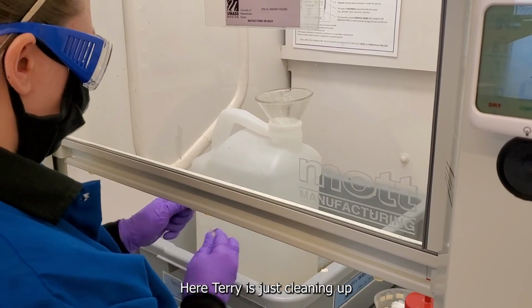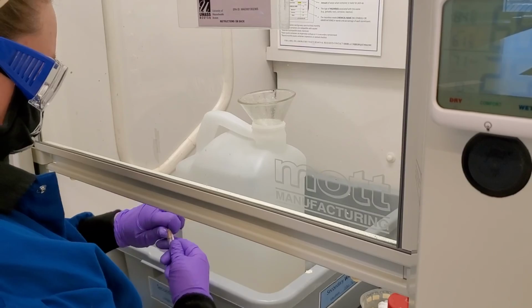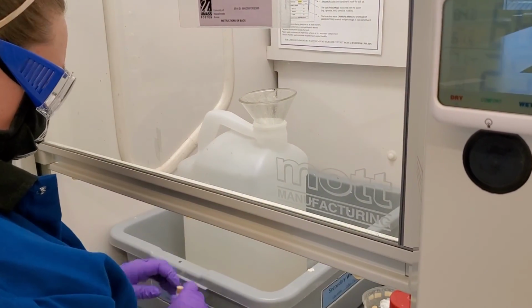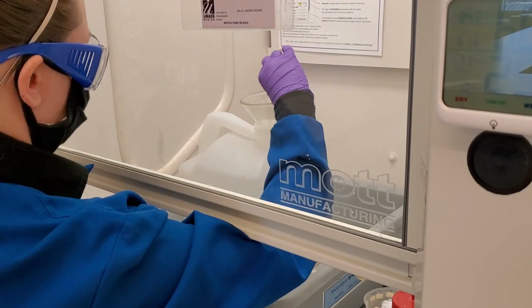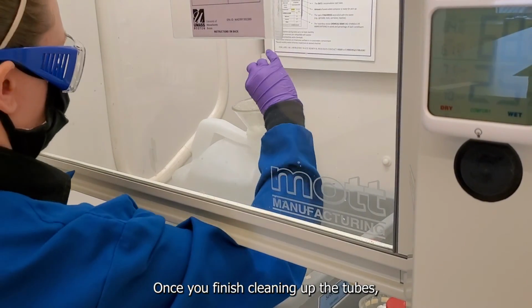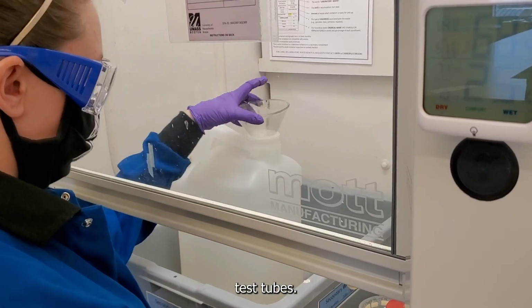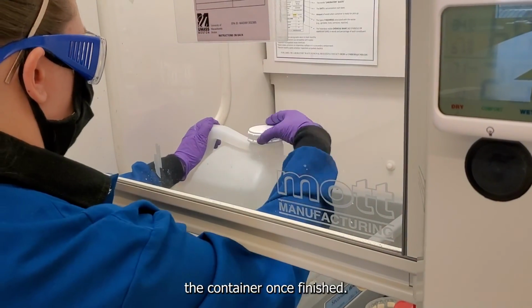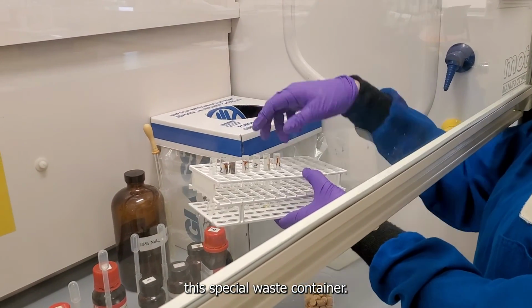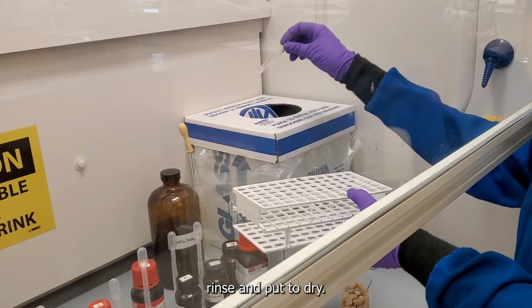Here, Tara is just cleaning up all of the samples. Once she finished cleaning up the tubes, you can see her dispose of the glass test tubes. Make note, she also closes the container once finished. Here, the test tubes can go in this special waste container. Once you are done, make sure any other glassware is rinsed and put to dry.